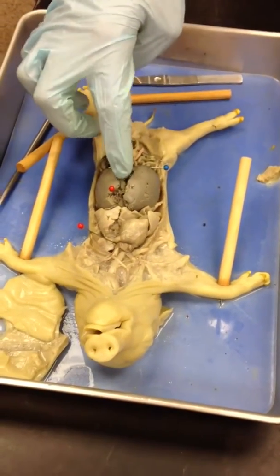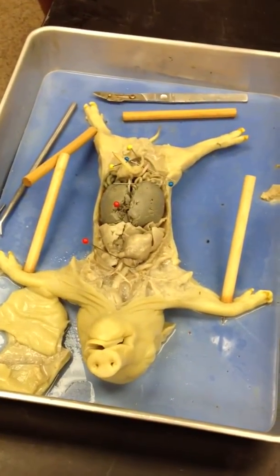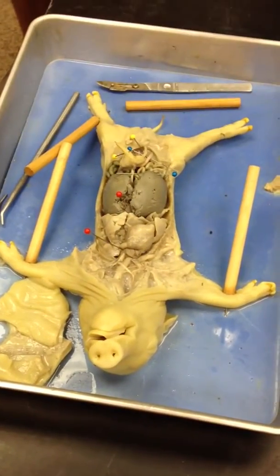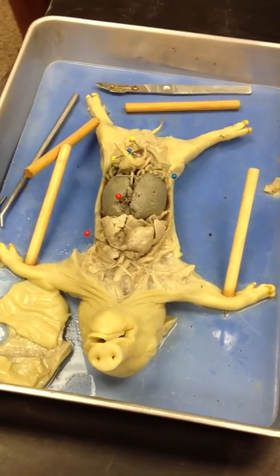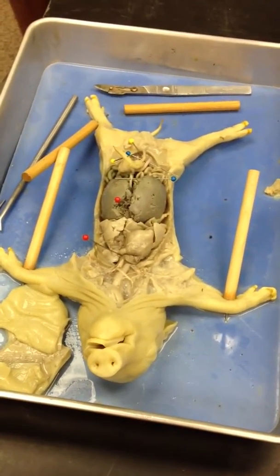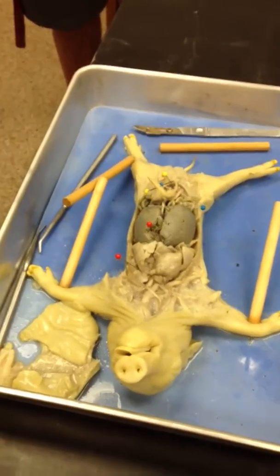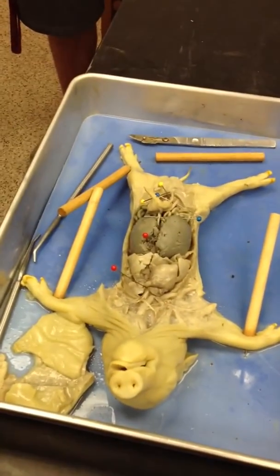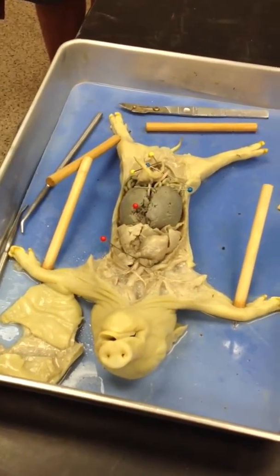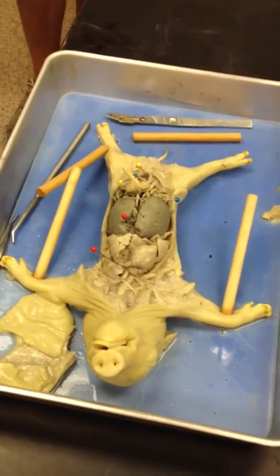Ductus venosus, ductus arteriosus. After it's born, I'm not exactly sure what goes on in there, but I'm sure it just disappears. And with this one, it becomes a ligamentum arteriosum, a ligament right there. What does that red pin, the top one, what'd you say becomes the tendon? Oh, this ligament here, the ductus arteriosus, number one.